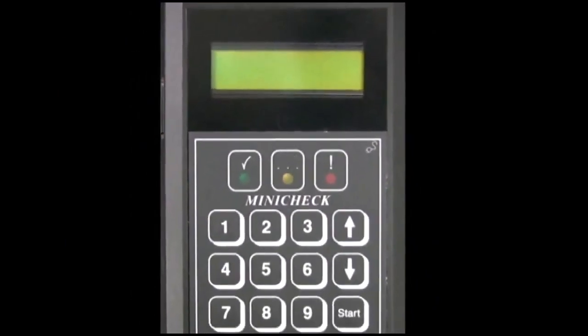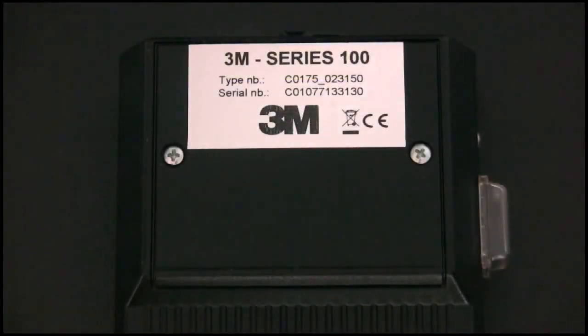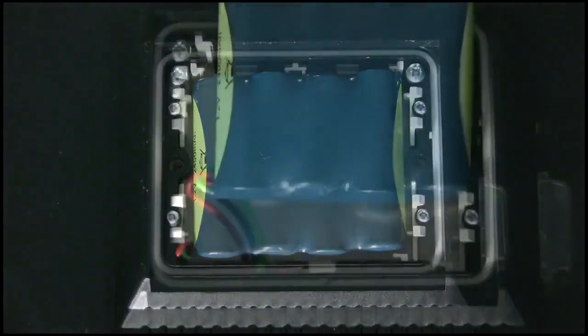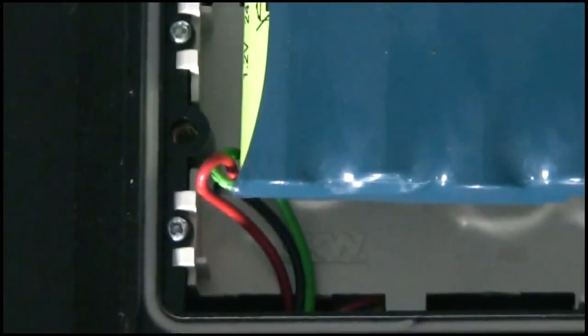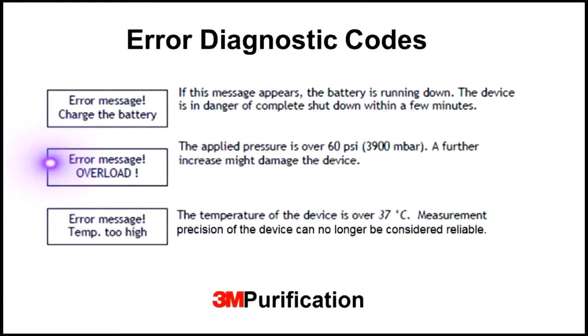The battery typically lasts 2 years. The battery can be accessed and replaced via removing the battery panel on the back of the device. Because of the complexity of the wiring involved, it's recommended to contact 3M Purification technical support to complete the task of battery pack replacement. This message is an indication that the maximum recommended pressure has been exceeded. Pressure should be immediately reduced or the device disconnected from the pressurized system.